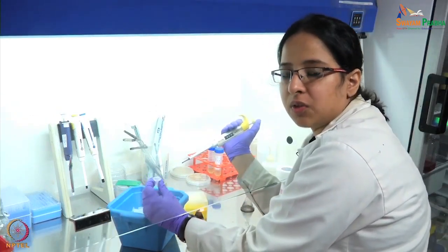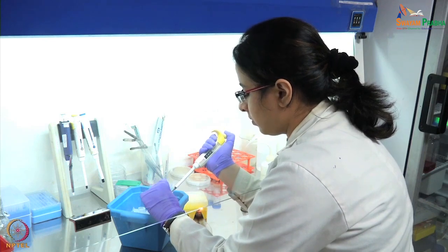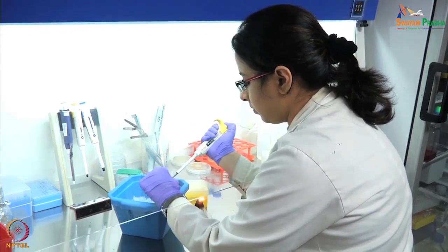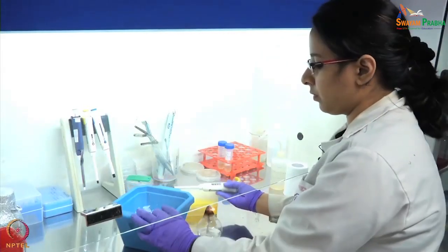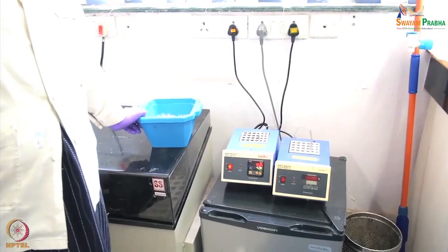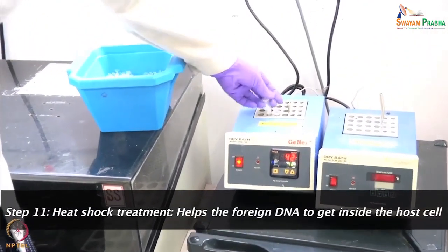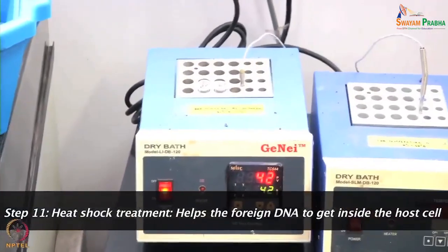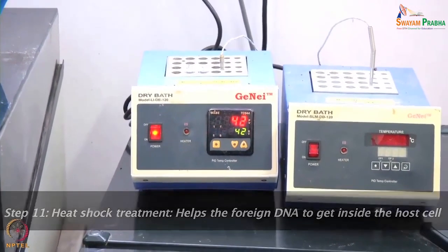This is our ligation mix which we will add into the competent cells. Now we will incubate the tubes on ice for 30 minutes. After that we will give the samples a heat shock treatment — we will keep the tubes at 42°C for 2 minutes. This heat shock treatment helps the foreign DNA to get introduced inside the host cells.